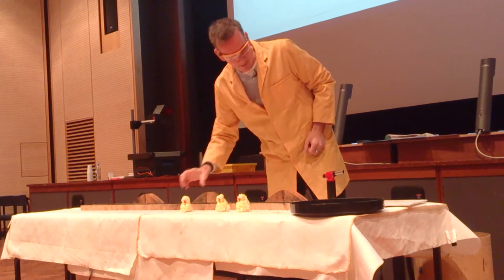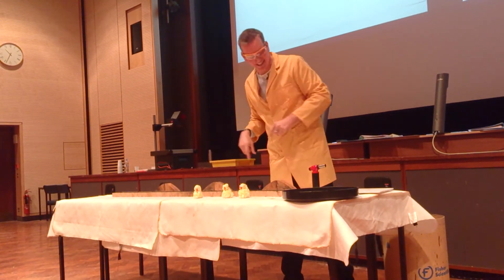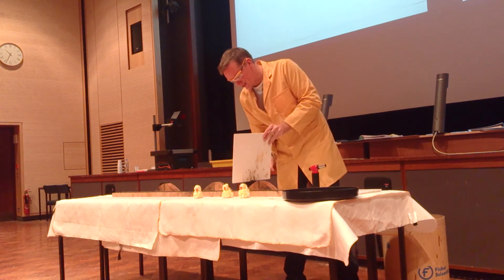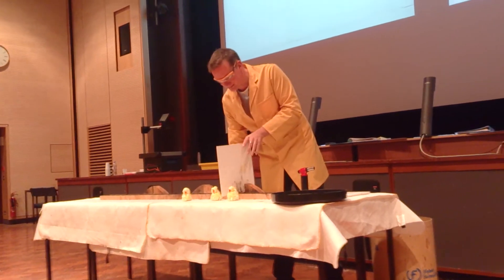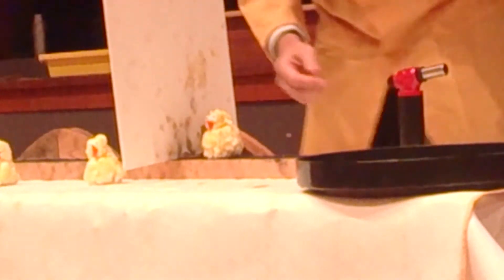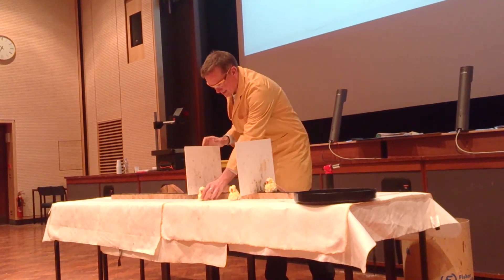I need to make sure that one little chick doesn't set off the next little chick, so we've got some dividers here just to try and protect them to some extent. I'll put that in there. And we have our first little chick here, facing you. And we're going to have our second little chick.